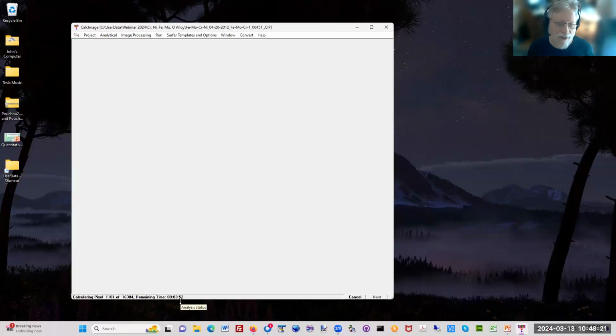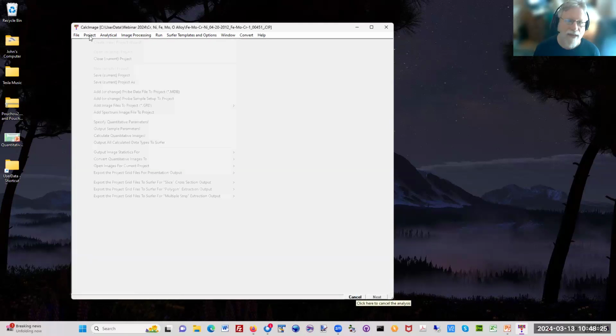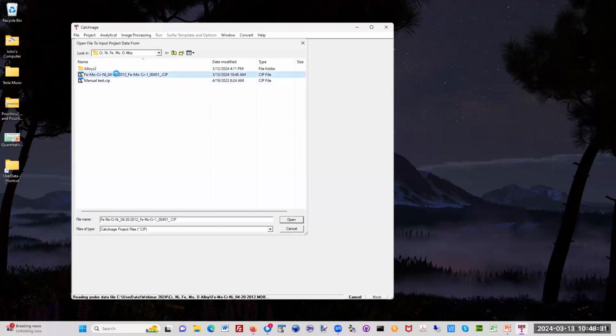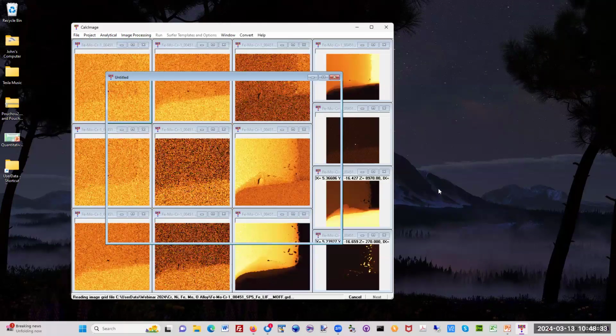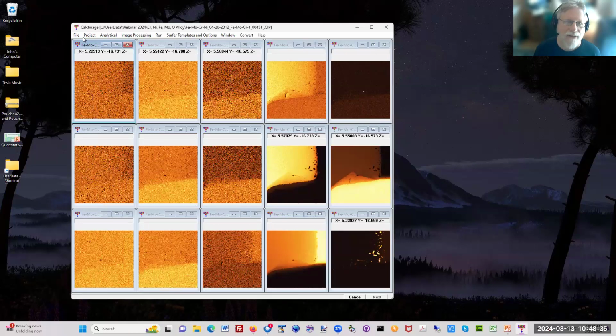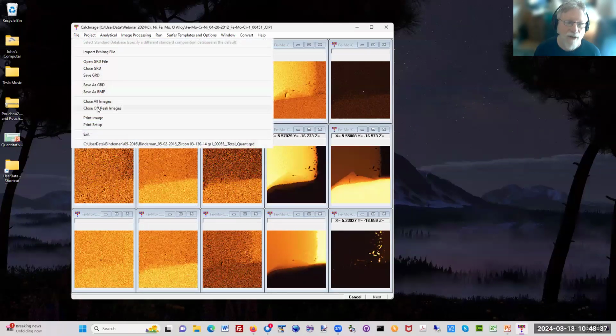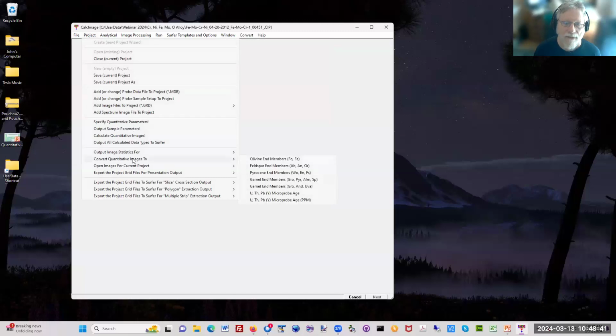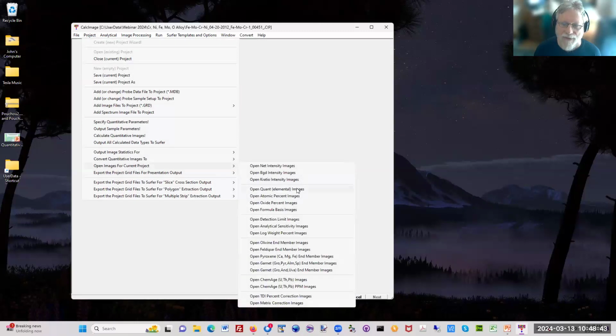And so this is going to take 4 minutes for this map. But I'm not going to wait 4 minutes. I'm going to cancel and close this project, and open up the same project because I've already quantified it. Okay. And here you can see this is the raw data maps. I'm going to close them all up again and open just the quantified maps for that already.